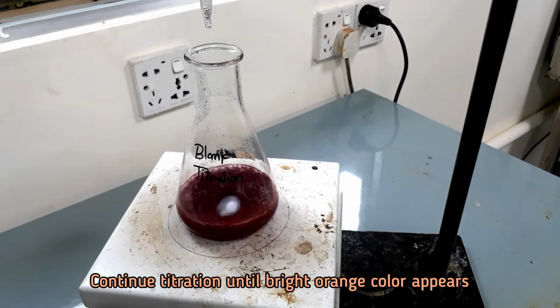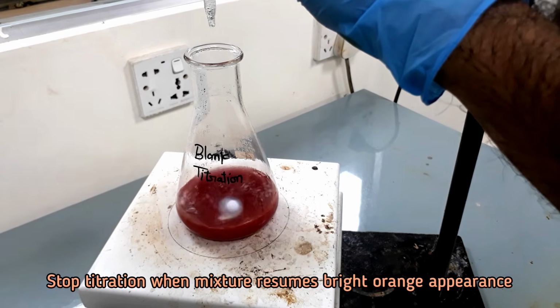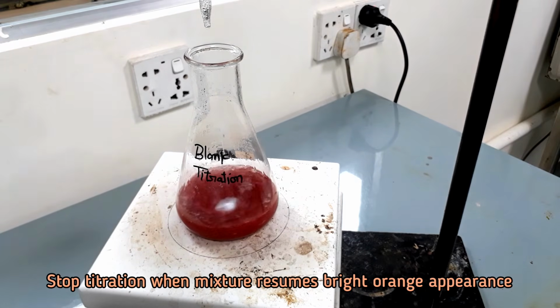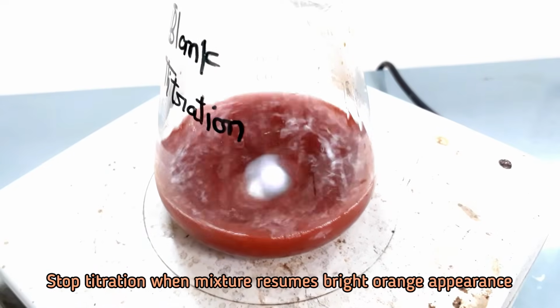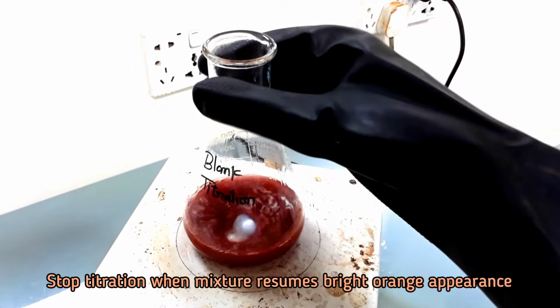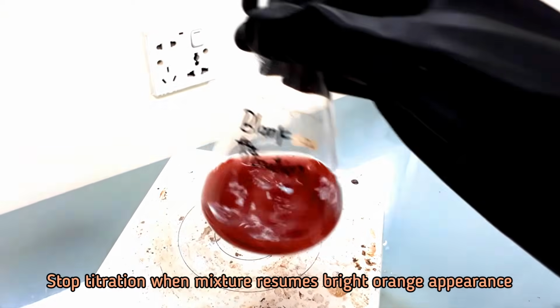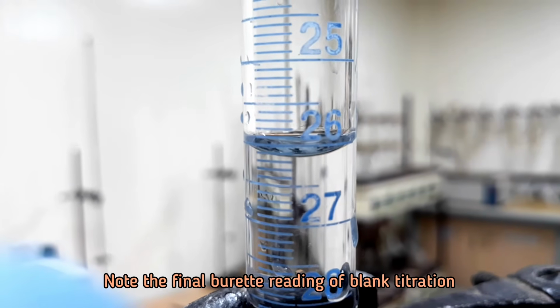Continue titration until bright orange color appears. Stop titration when the bright orange color resumes, as the color was seen before the addition of methylene blue indicator. Note the final burette reading of this blank titration.